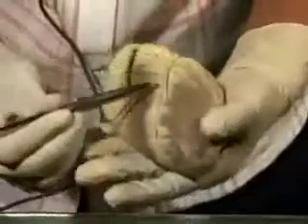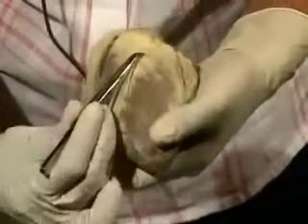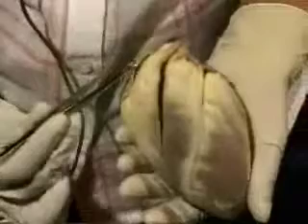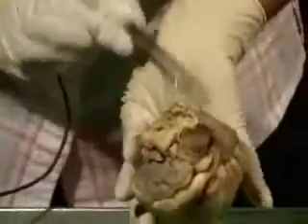Now let me show you the dissected specimen. So this is a dissected specimen. So again, this is the right ventricle. This is the thin sulcus which is going through it. You can see this thin blood vessel which is the vein. This is the right ventricle. This is the left ventricle. Right auricle, left auricle. This is the rest of the right atrium, and then the left atrium is present posteriorly.